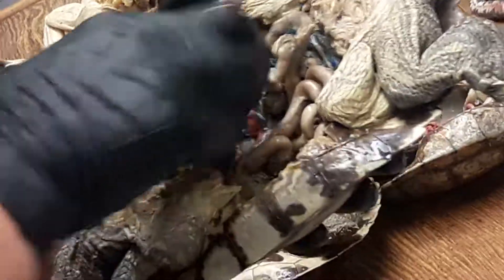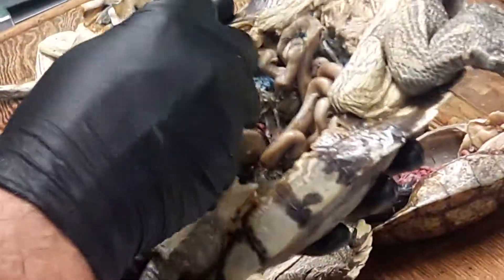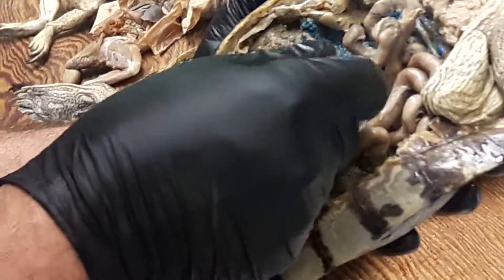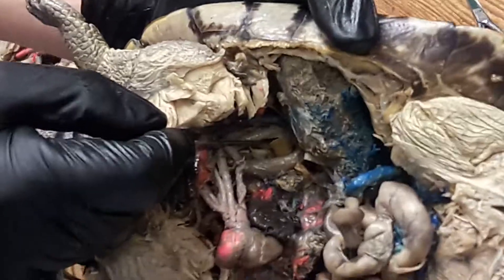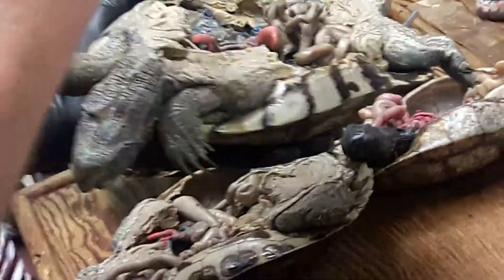The pulmonary likewise is heading down to the lung, and this is also kind of tricky to see in the turtle. But you can kind of see it running over here alongside of the bronchus. Here's the bronchus running down to the lung, and there's a branch — that's the left pulmonary artery coming along with it, going down to the lung. I admit that's probably not that easy to see, but take my word for it.